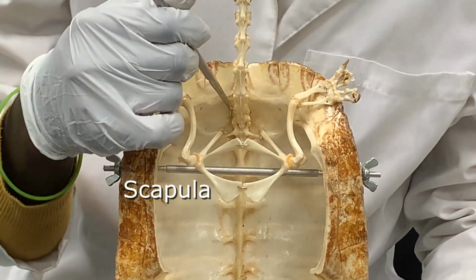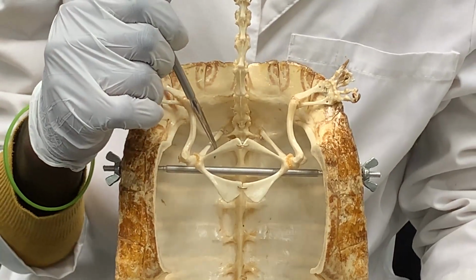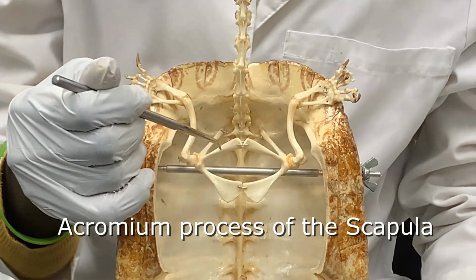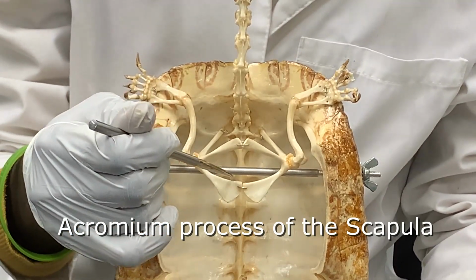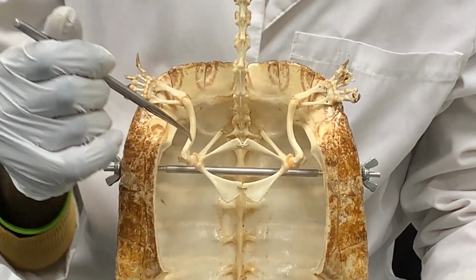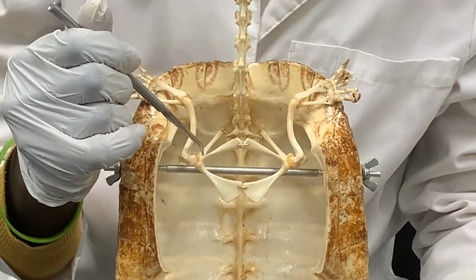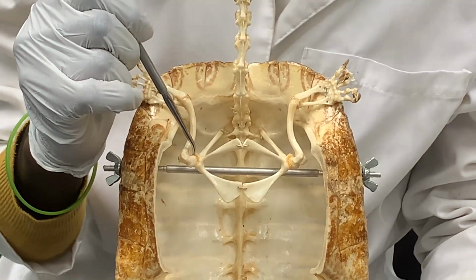You can see that it attaches to the carapace at the back here. The scapula has a process called the acromion process. The fusion of the coracoid and the scapula forms the glenoid fossa, and that's where the head of the humerus fits in to form the ball and socket joint.